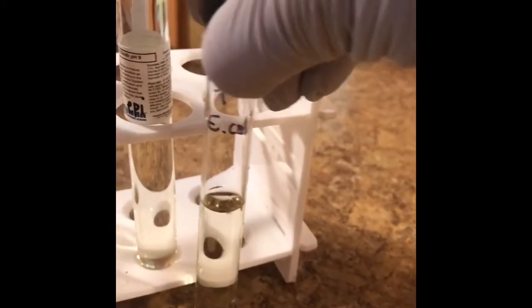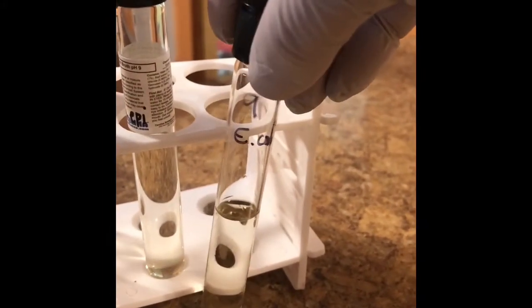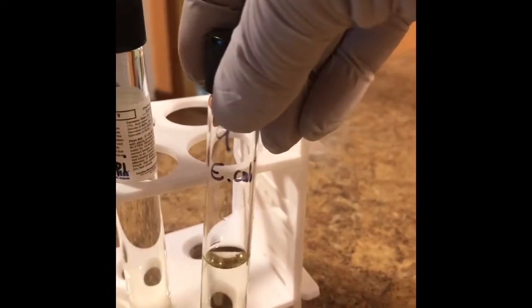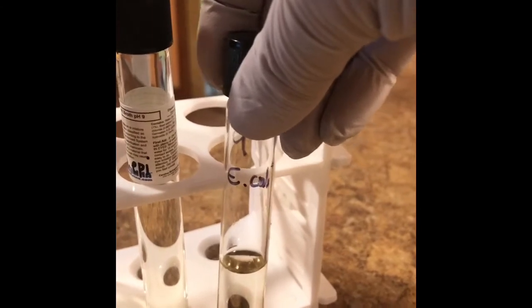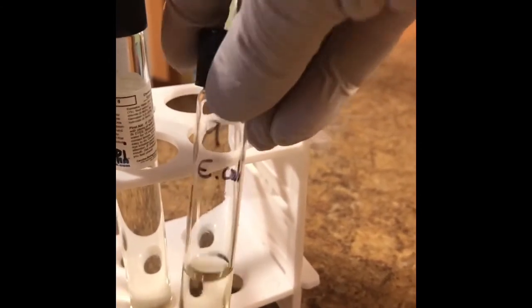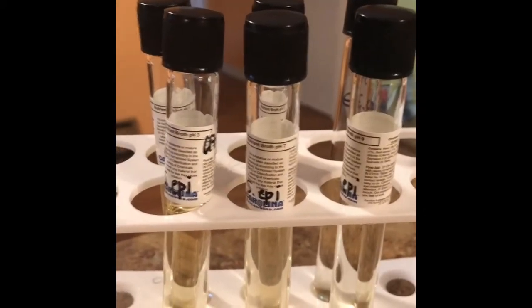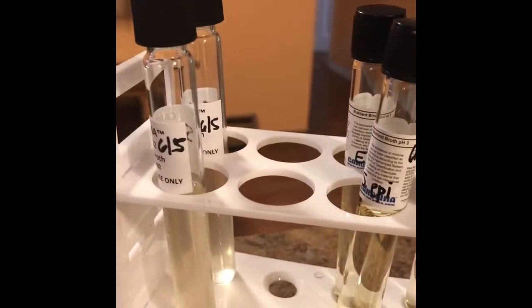Now, one thing I noticed when I took out the tubes for pH of 9, my second one, which I labeled for E. coli, you can see it's got half as much broth. There was a spill, which most likely means this has been compromised. Even though it's still clear, something happened. So I would make a note that it could become contaminated. The label slid right off, so I just labeled it 9 for pH of 9 and put E. coli on there. We're doing this just like you would be, so I want to point out these potential problems.